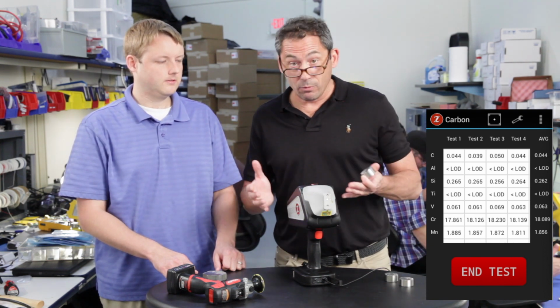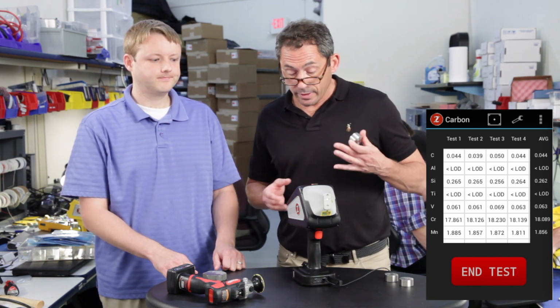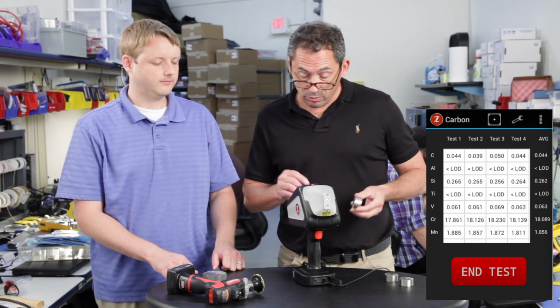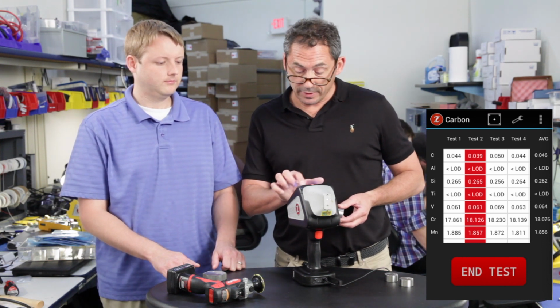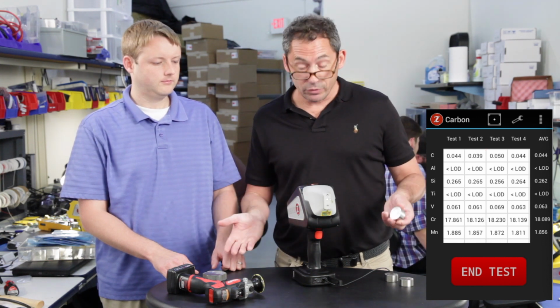Now let's suppose you look at one of these readings and you don't like one because it's high or you got a bad burn. You OES guys know all about that. So let's say I don't like this one right here. I tap on it, it makes it red, and it removes it from the averaging. So you see how my average went to 046. If I tap it again, it comes back, average is recalculated.